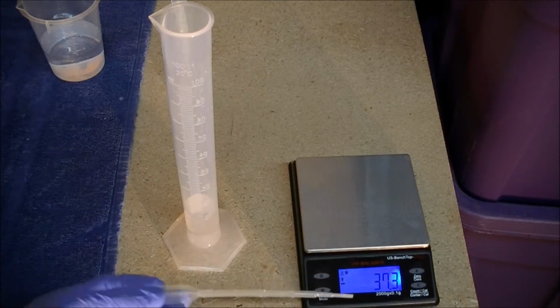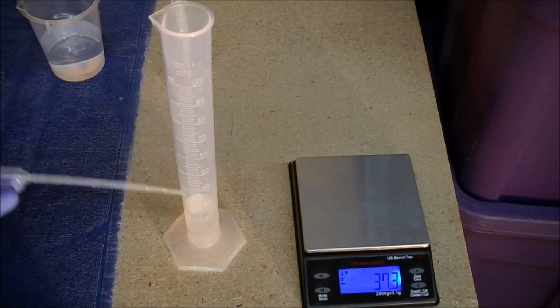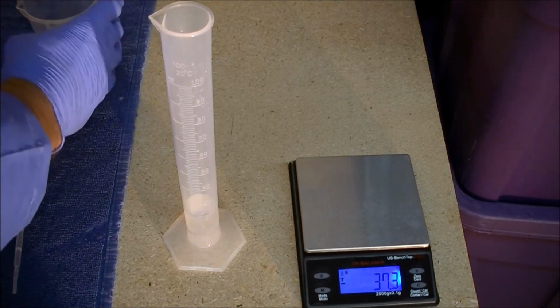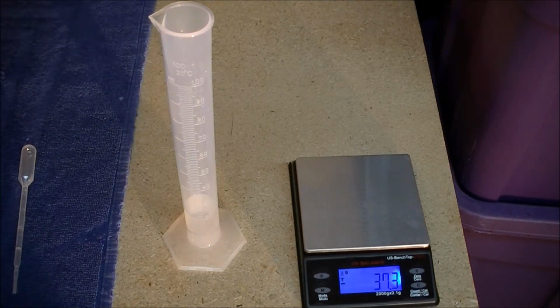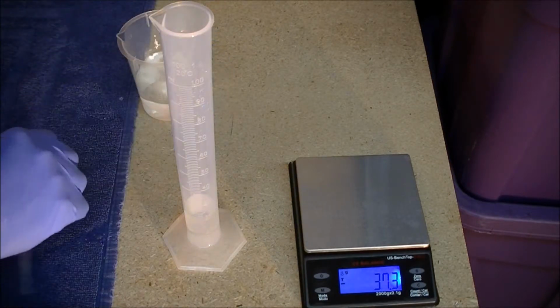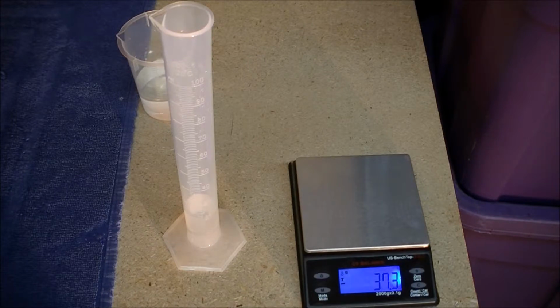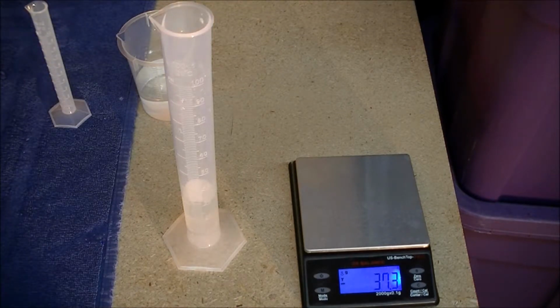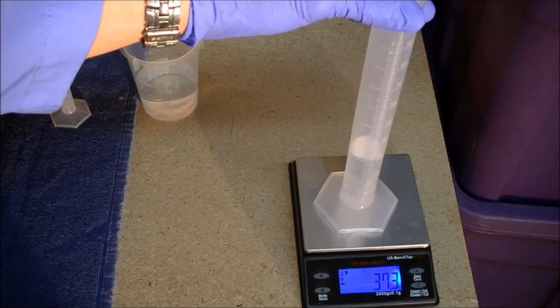So to prevent bias, we make sure that we remove the graduated cylinder from the balance when we're adding water, and then we convince ourselves to the best of our ability that we've added the desired amount of water, and only then do we move the graduated cylinder to the balance to measure the mass. So first we measure the volume carefully in the graduated cylinder using the meniscus and so on, and then we measure the mass.